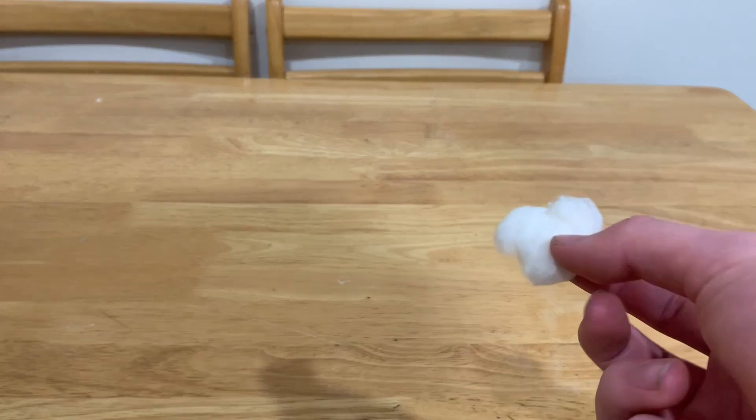So to actually start the process, you need to grab something which can be used as a membrane. A piece of cotton should work just fine. I would not recommend making the cotton membrane too thick — just enough so it stays in there when water is poured in on one side. The only reason it is there is to stop the products from reacting, so you make it thin so there is not much resistance, meaning the current is stronger and thereby increasing the reaction rate.